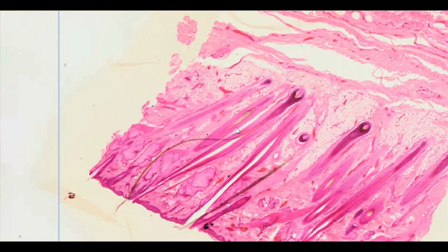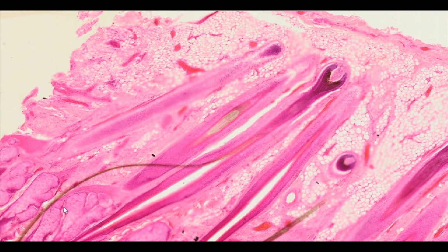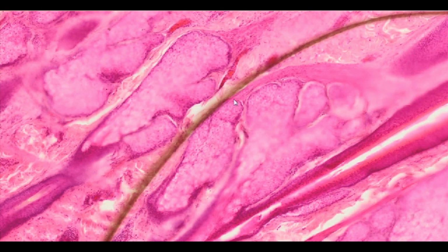The hair is made of a hair shaft enveloped in inner and outer sheaths, and additionally surrounded with a thin layer of dermis, called the hair follicle. Sebaceous glands are attached to each hair follicle, releasing the sebum directly into the root sheath. These glands have a berry-like lobular shape.